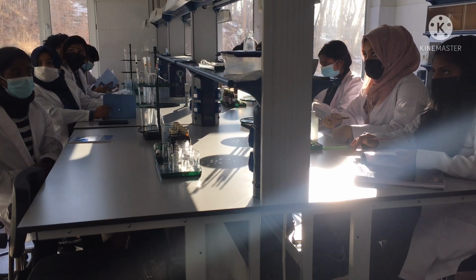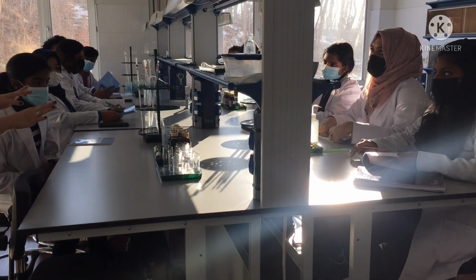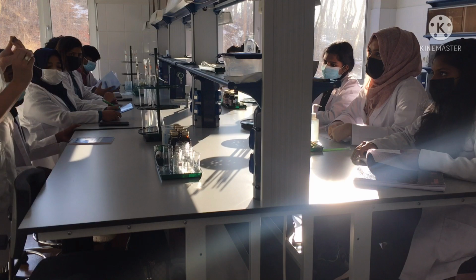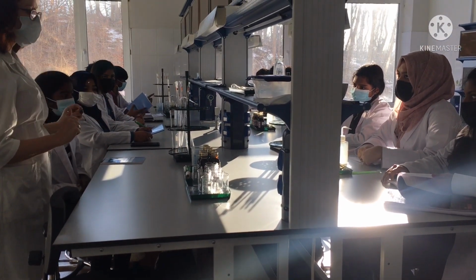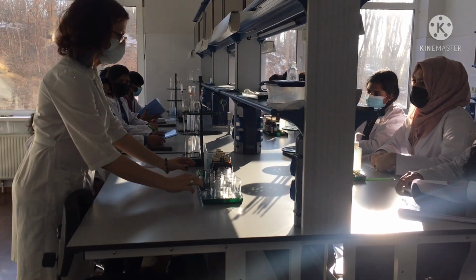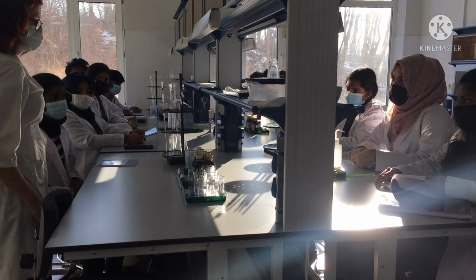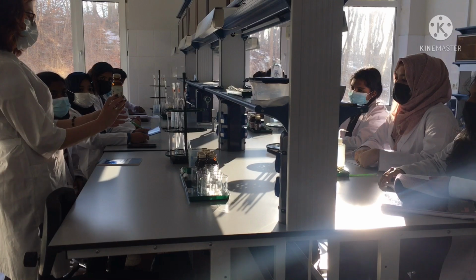First, briefly, the safety rules. We do not touch any liquids or solids with our hands. We only use special equipment for this. We will not break the discipline here in the laboratory. It's very important.